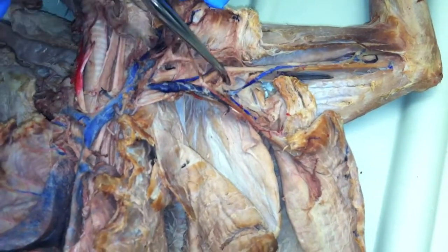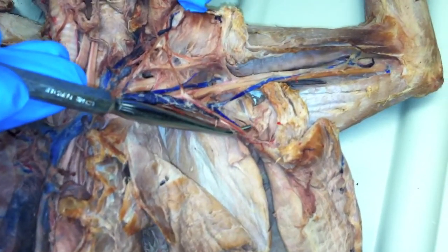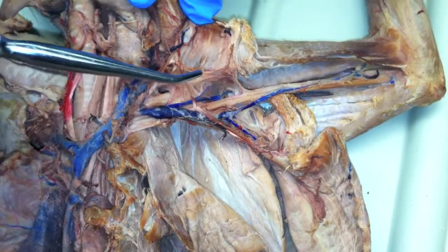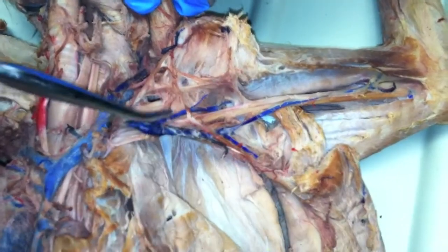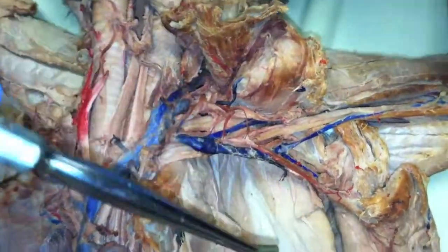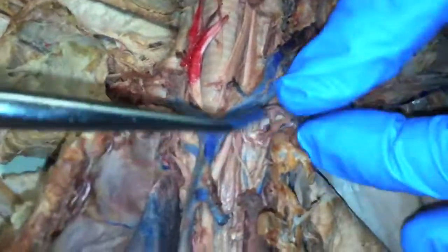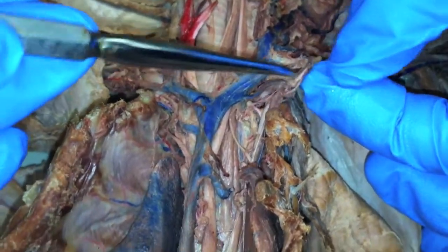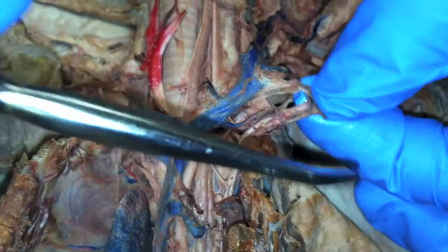And then out here, this is your long thoracic right here, going down. And then it becomes all brachial from that point on. These are other branches you don't need to know. So it should be brachial from here on out. Can you do your long and ventral thoracic on that one? Ventral and long thoracic. See that little broken one? That's got to be the ventral. And then long is this one. Ventral kind of goes out, and then the long kind of goes down into this musculature here. This looks like your internal mammary up here. There's your internal mammary going up that way. There's your costocervical right there.